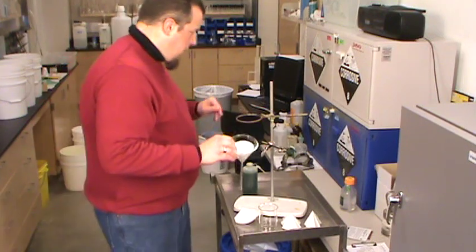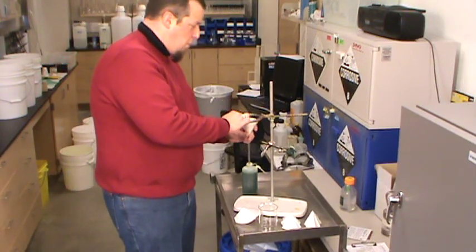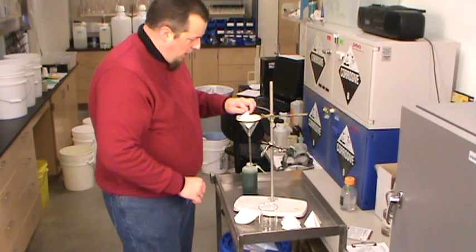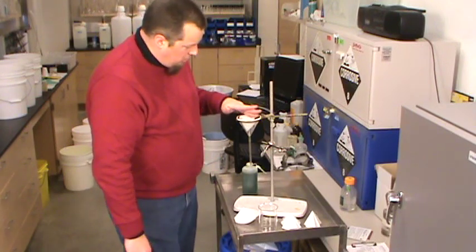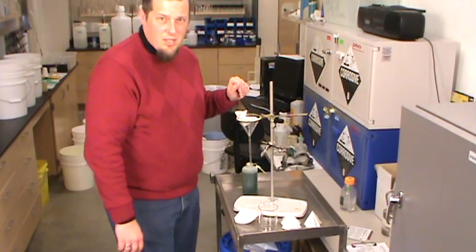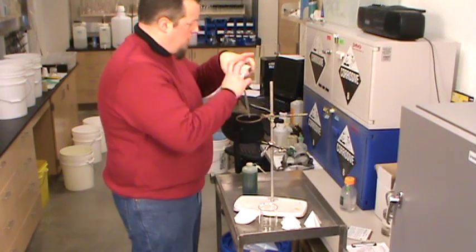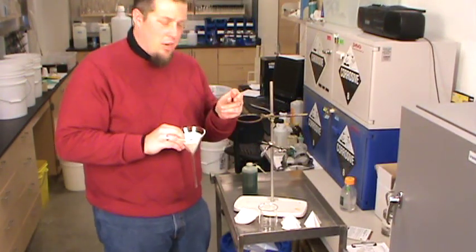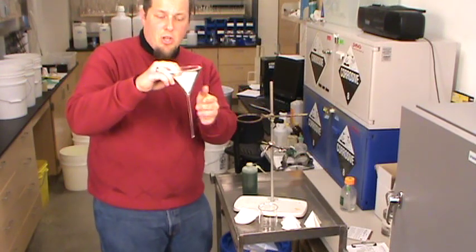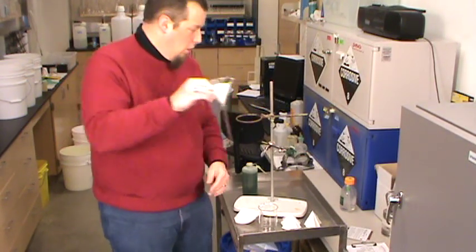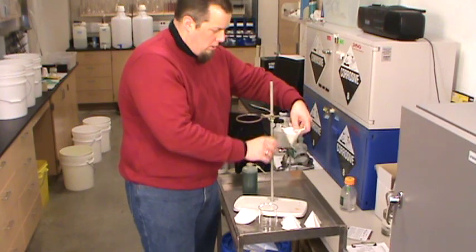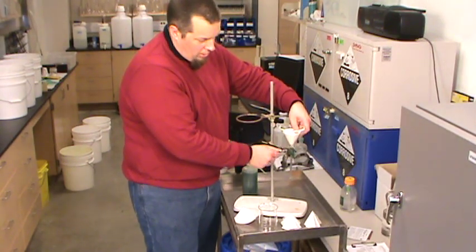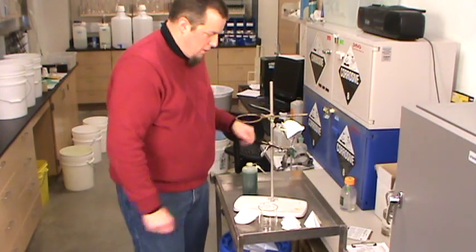The best way to usually do this is either with a ring - find an appropriate size ring and it holds that filter pretty nicely there - or probably at this point easier to find one of these little three finger clamps. You can clamp right on to the long stem. That's one of the advantages of having a long stem on here, so clamp that long stem - that holds it pretty securely.